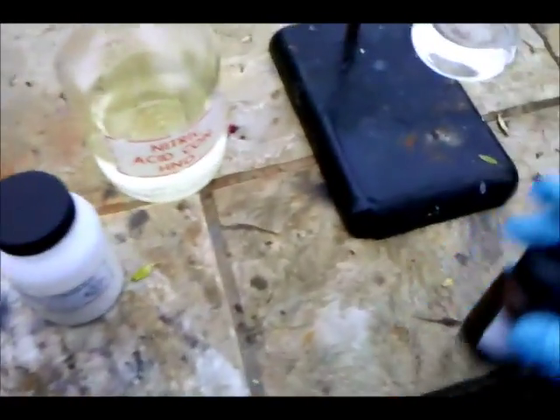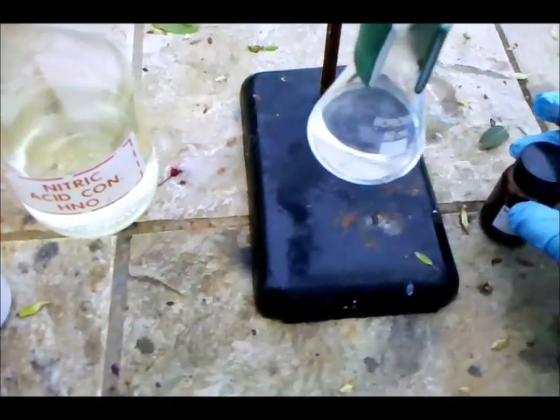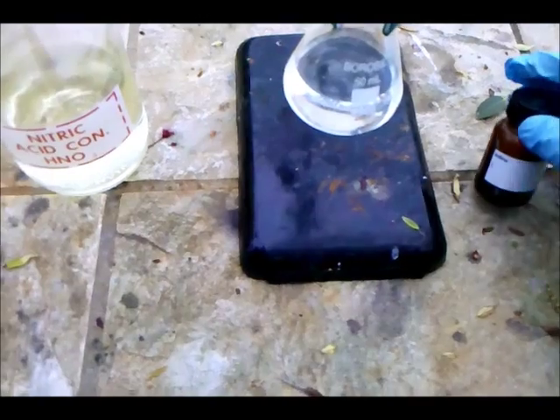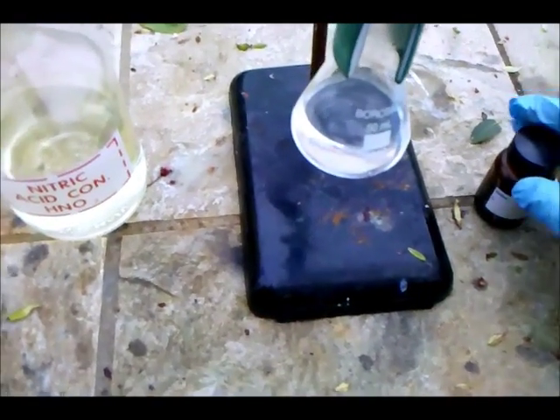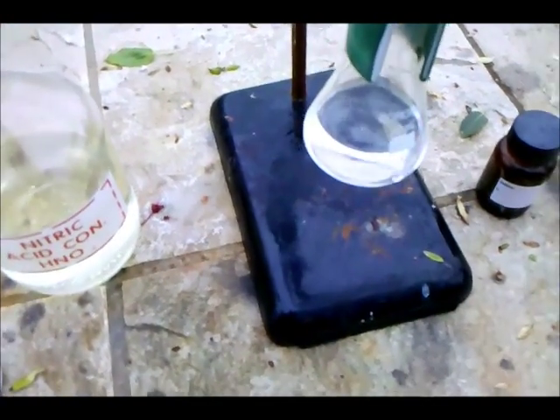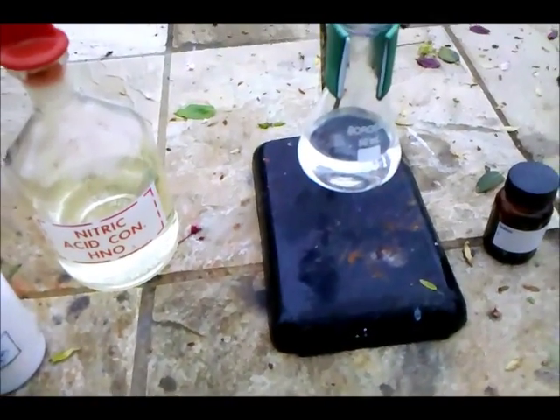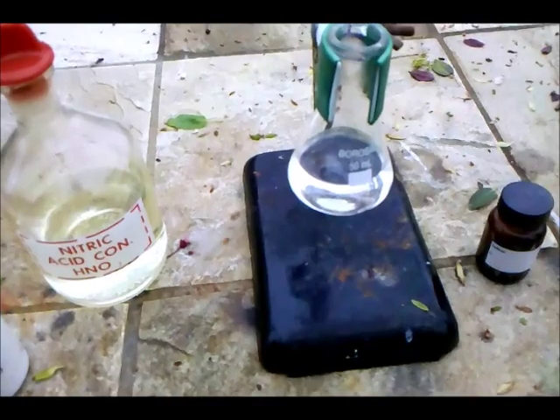After this is done you can start adding your elemental iodine. This will convert the iodine to iodate while producing some chlorine and chlorine dioxide, so be very careful and work outside.